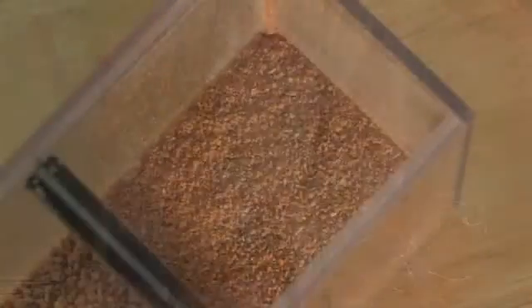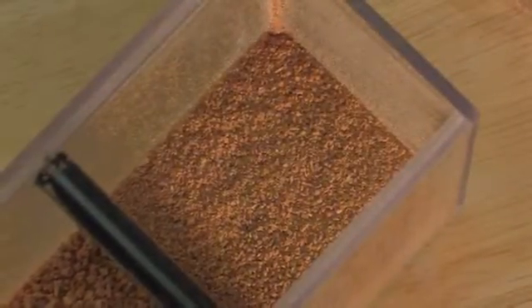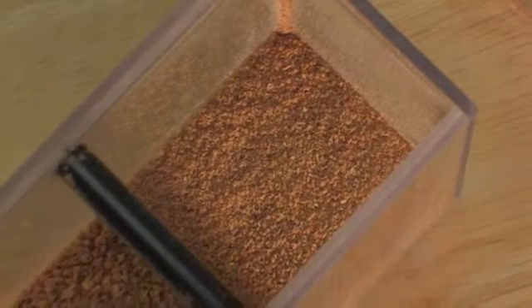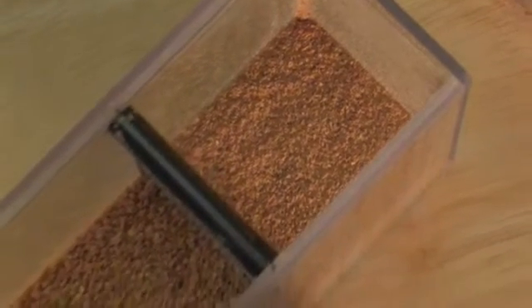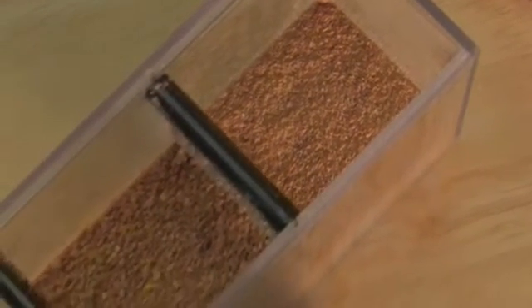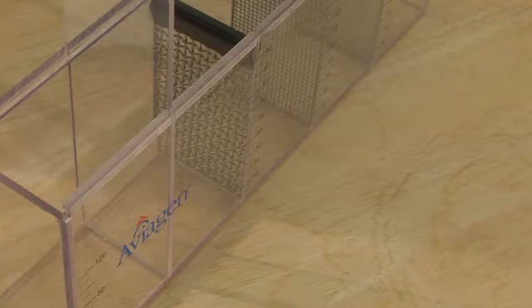The Shaker sieve is a useful, portable tool for quantifying the particle size distribution at farm level and allowing comparison with the recommended particle size distribution. This will also allow quantitative comparison between feed deliveries or flocks.